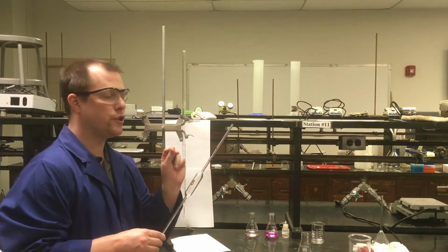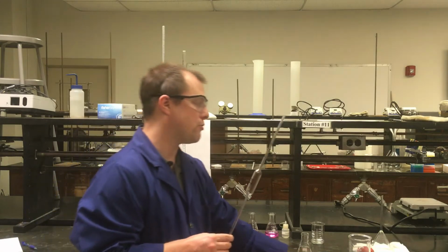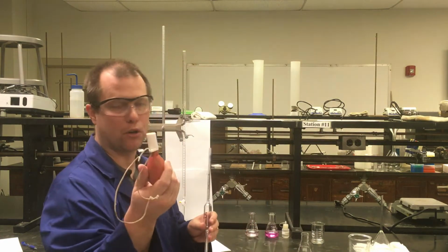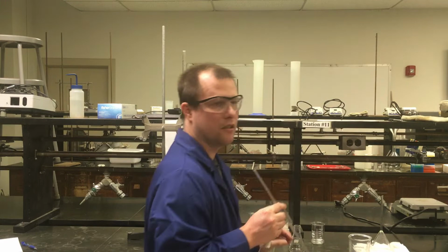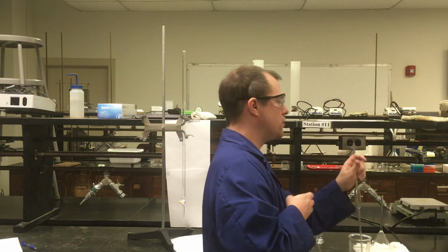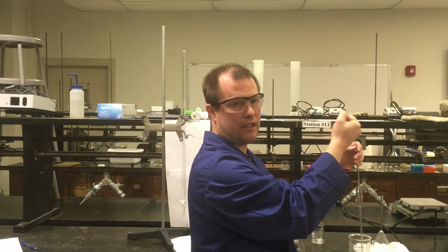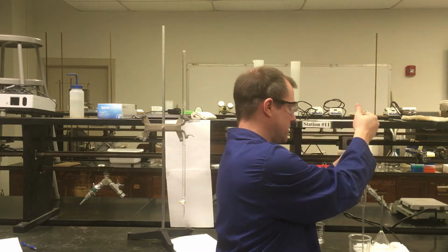And so we're going to use this volumetric pipette, and I'm going to demonstrate that here real quick to measure out the volume of our starting acid solution, or KHT. And what I'm going to use to do that is this bulb, along with our pipette. If you've never used a bulb and a pipette like this, you're going to want to squeeze the bulb first, put the bulb on top of the pipette so that it makes a seal, and then let go of the bulb so it's going to suck up the liquid. That's the general process for this.